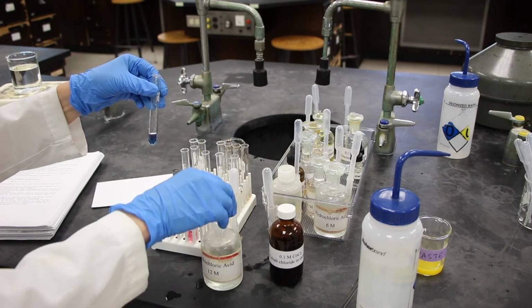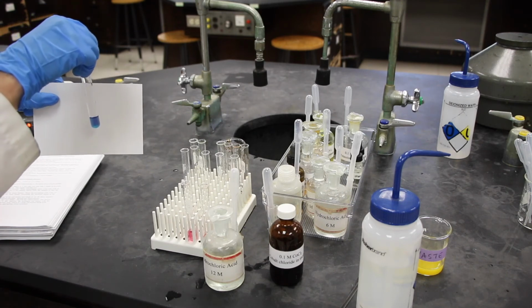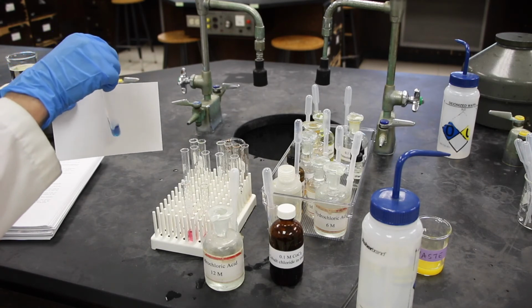And I'll give this a little shake. And you can answer the questions QD1 through QD3.